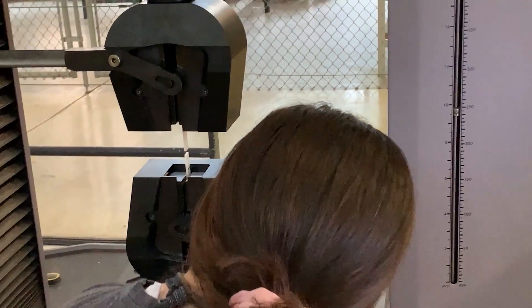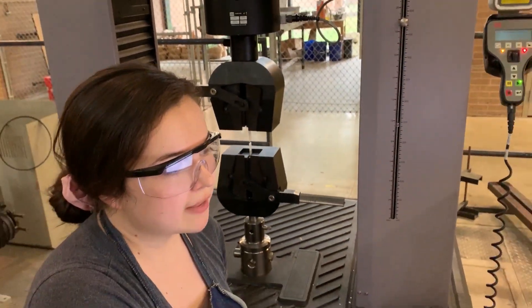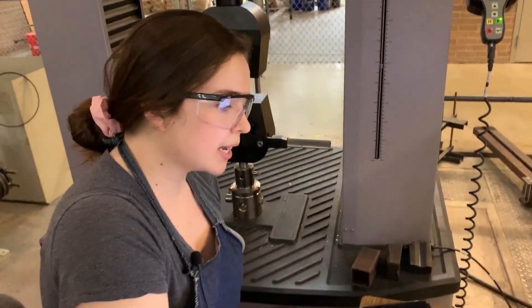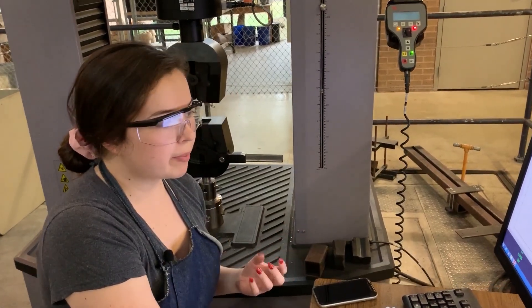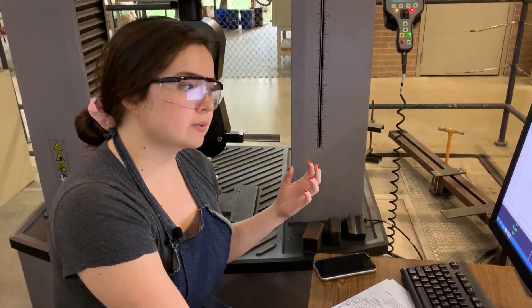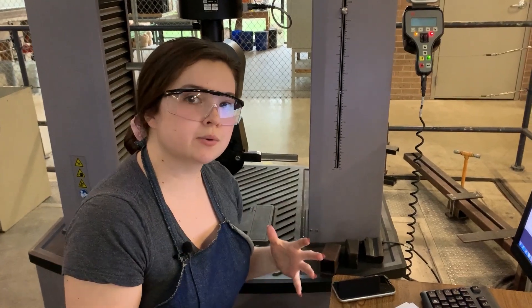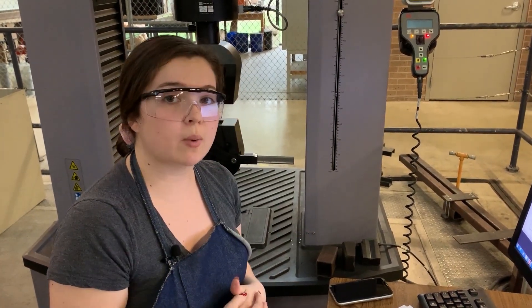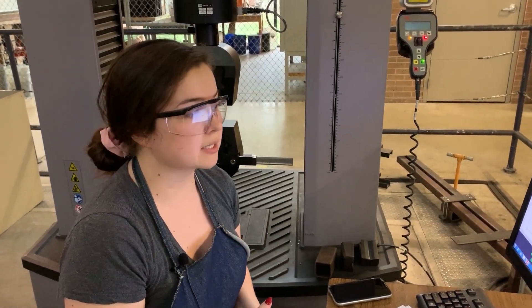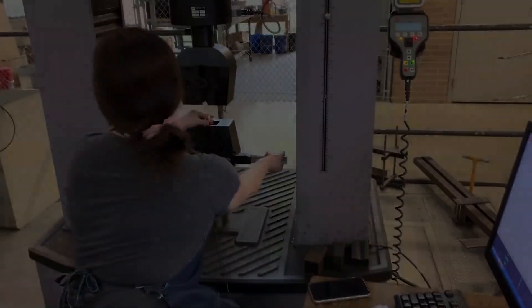We can see it didn't elongate very much. This is probably because, even though it is a rubbery polymer, the temperature in the room is a little too cold — that's probably another reason why it could fracture as if it was a glassy specimen. We're going to take this out now.